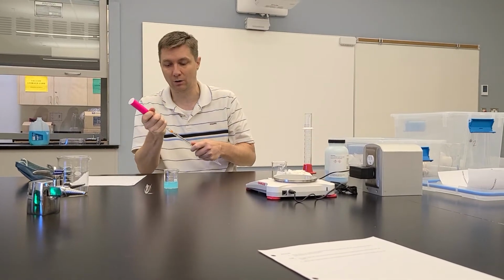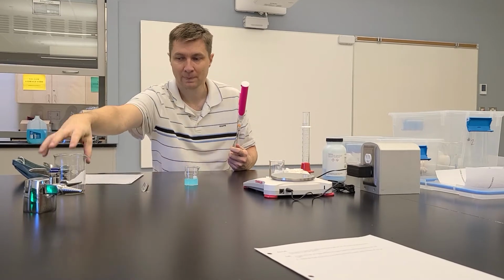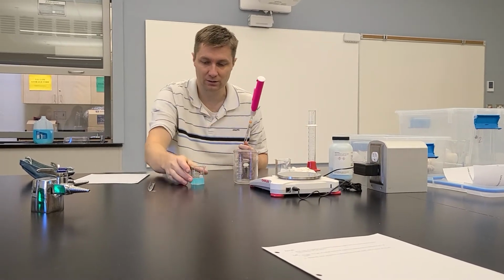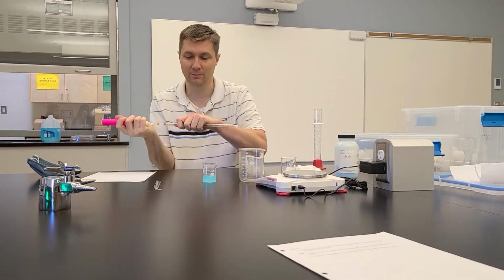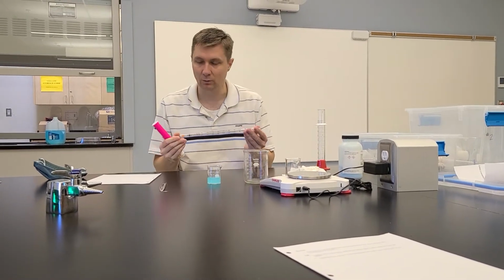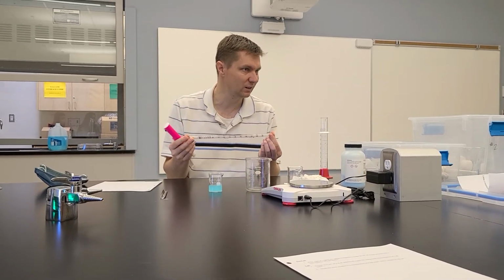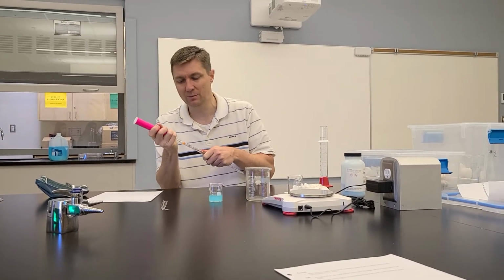Once you get that number correctly, and you know how much of the stock solution you're going to pipette out, I'm going to use this bigger beaker right here to put what I'm pipetting out. And this is the pipette right here. This is a very, very specific, very detailed way of measuring 10 milliliters exactly, or anything that's less than that, okay? So I'll just pipette 10 mils out.